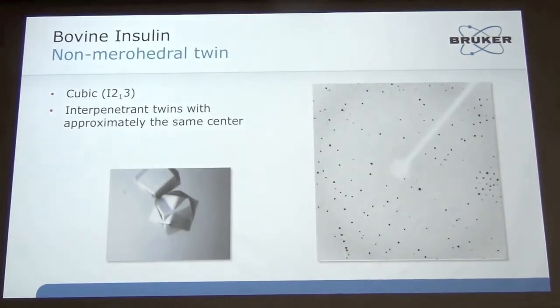So this is an example of an interpenetrant twin. It's bovine insulin. This was grown in George Sheldrick's lab. And in this case, the crystals grow from one center but grow out as multiple crystals. And so if you look at the diffraction pattern, something doesn't look right, right? You see a lot of spots that are very close to each other that just don't really fit the general pattern. So looking at this, you would throw some red flags, spots like here and here that just don't make a lot of sense.